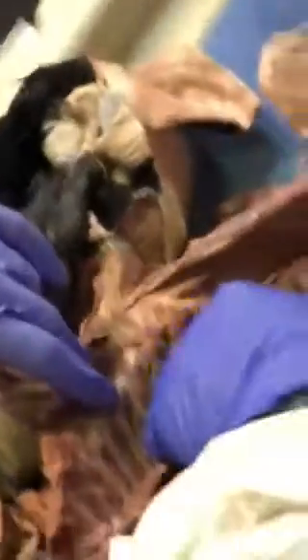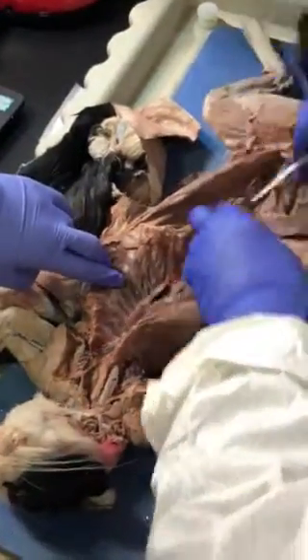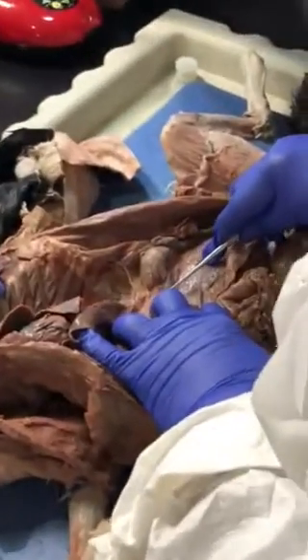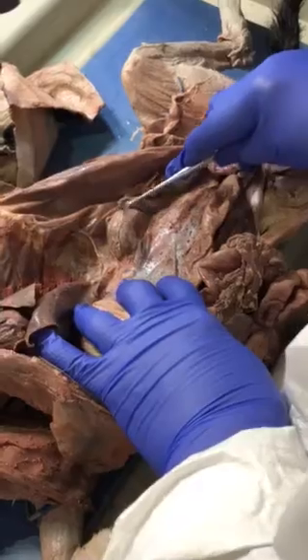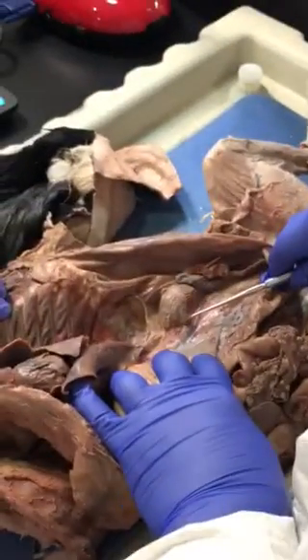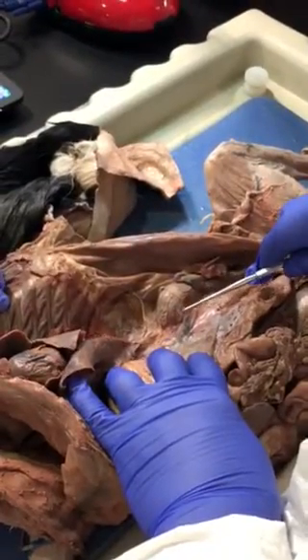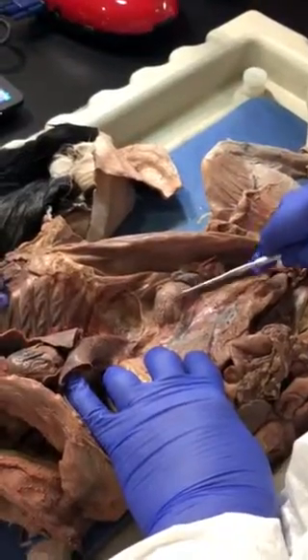Look at the blood — you have to clean that. Here is your kidney, and here is the adrenal gland. We said that where you find the veins, you find the arteries, you find the nerves, and the name of the vessels depends on the organs. So we have renal vein, renal artery, renal nerve.